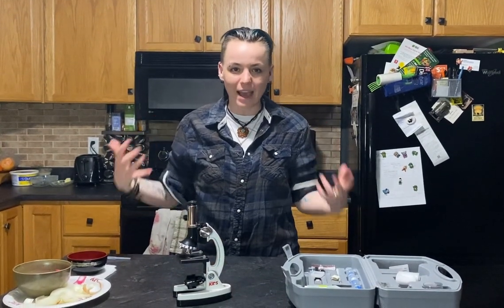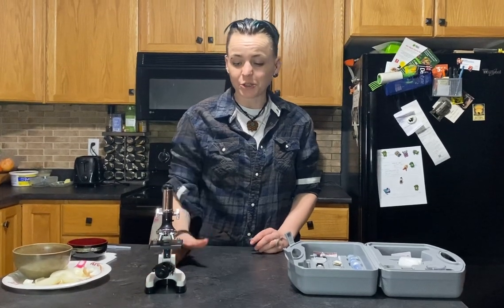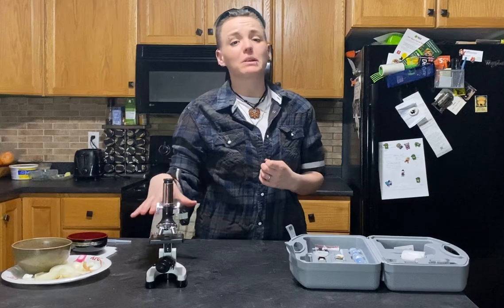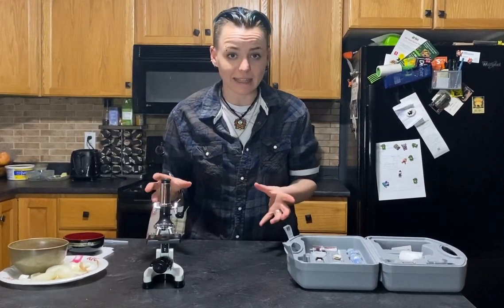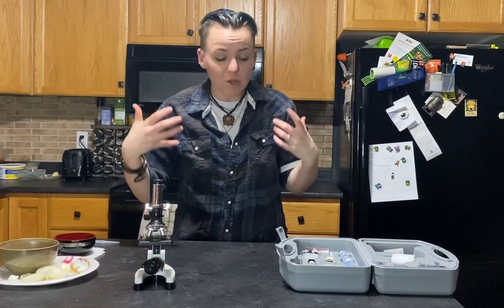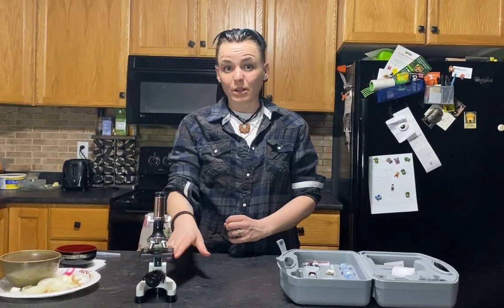Hello and welcome to another edition of Lab Rats. Last week you guys got your microscopes and learned about all the different parts of the microscope and how to use it. It's a very important part of science because we use microscopes to look at very tiny things and to understand them. So the next thing you need to learn is how to actually prepare a slide to look at under a microscope.